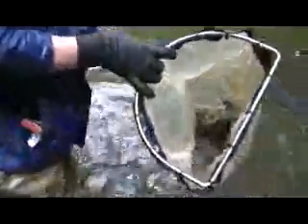Alright, and 30 seconds is up. You can see that this sample is a lot more organic matter than the previous sample was.